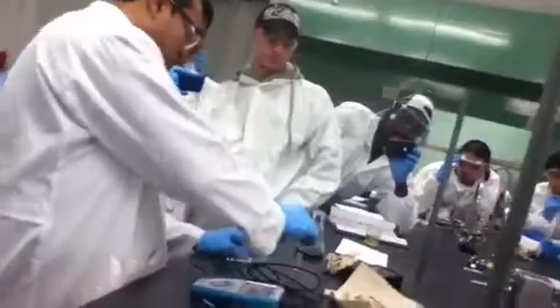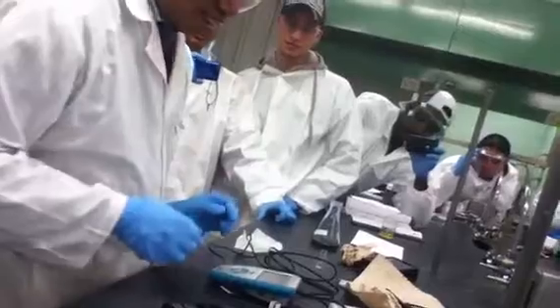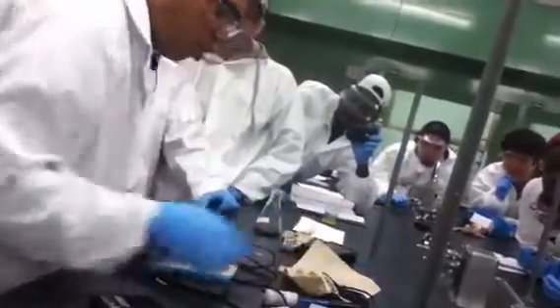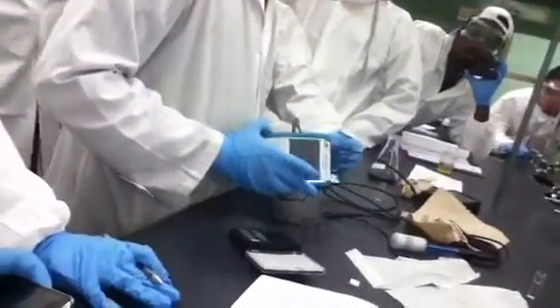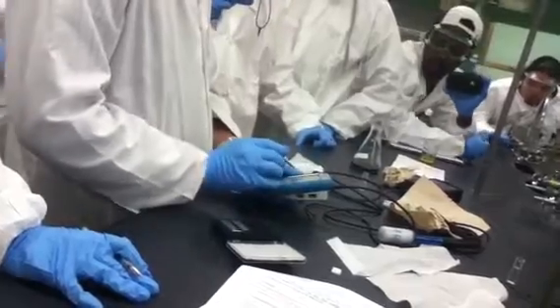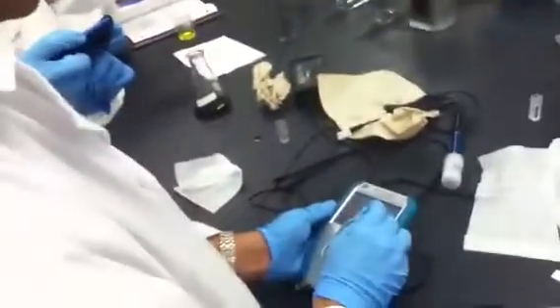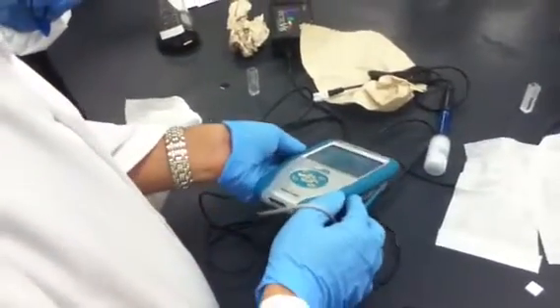All right, let's see what is. Give me the solution. We got the water. What is the solution? This is the toluene, right? Let's put it separate. So the first thing I'll be doing in this case is to calibrate. That's what I'm doing with the spectrophotometer. So it will start calibrating it in this case.